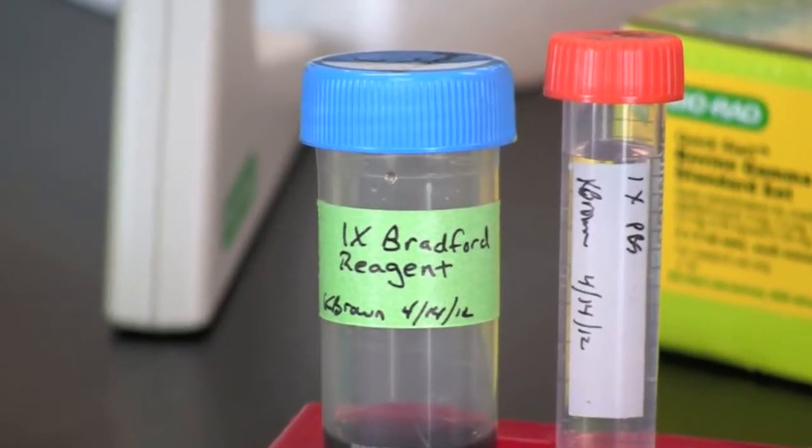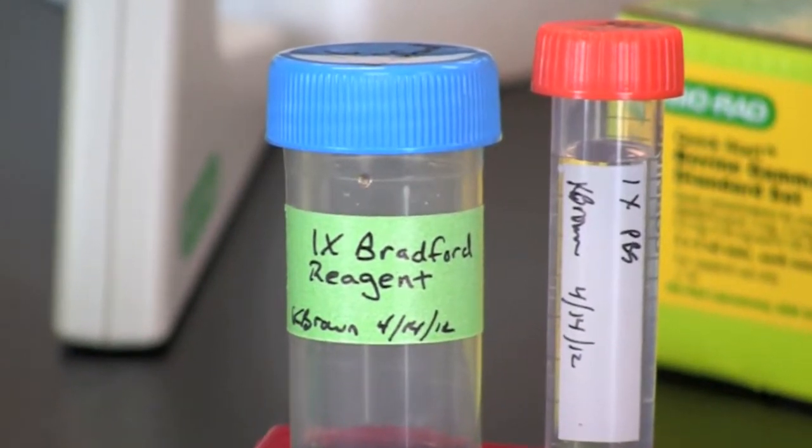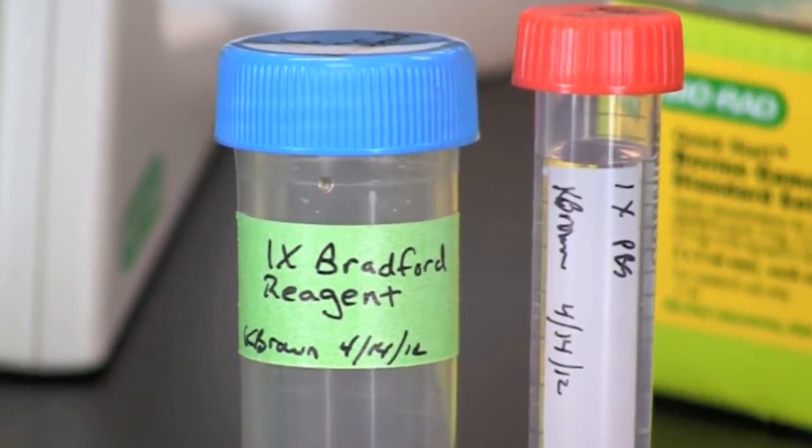For this activity, you will need 1x Bradford reagent and 1x phosphate buffered saline or PBS.